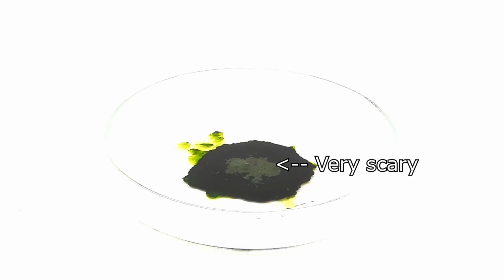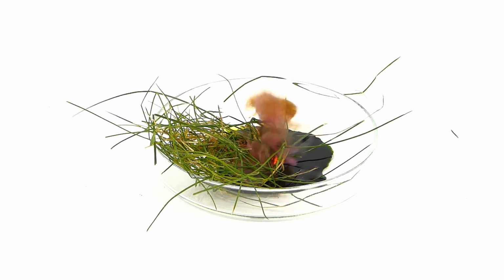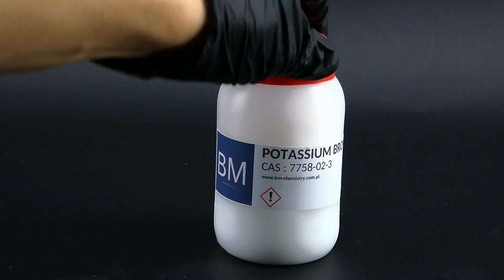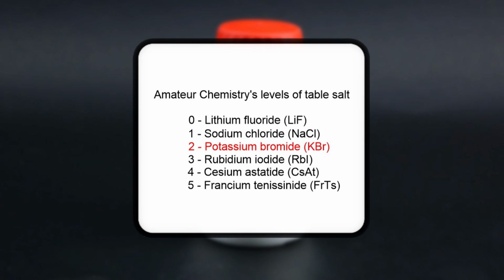As you may know, it's this green oil that is so oxidizing that touching it with something like a blade of grass can very rapidly decompose it, and this property is actually what I want for my bromine synthesis. You see, I will be starting from a compound called potassium bromide, which I like to imagine as a level 2 of table salt, and to rip apart something like table salt, you need a ton of oxidizing power.